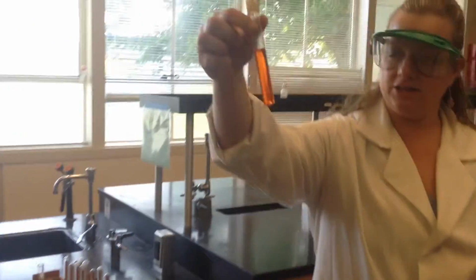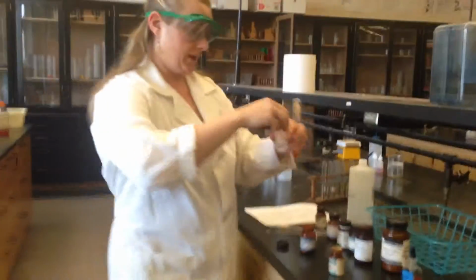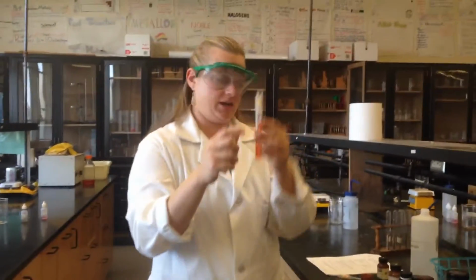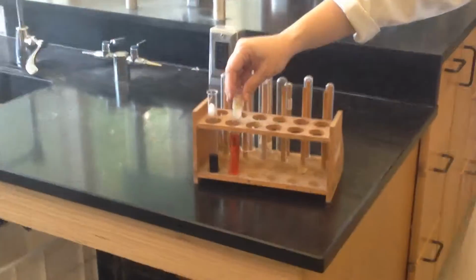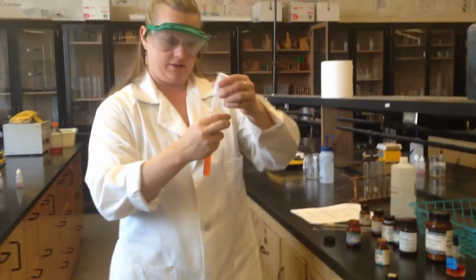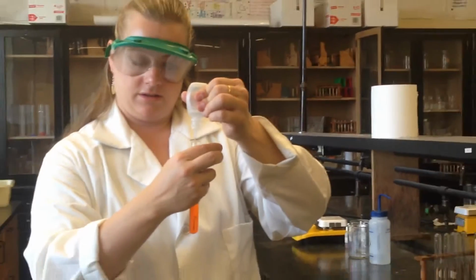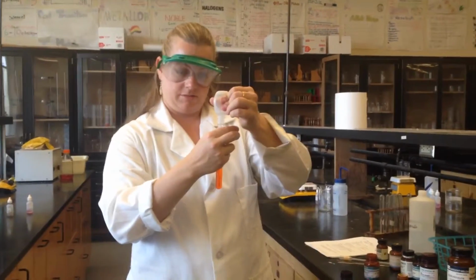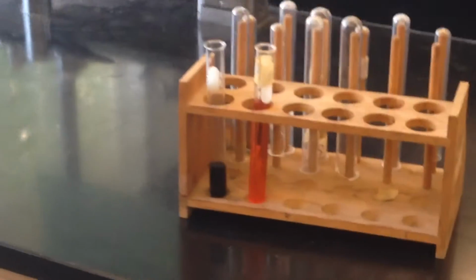So it's starting to turn a little yellow, but not too much. So this one we would say is not going to work well for the pH range. We would have to add way more acid to get a color change. If we added more, it would get yellower. I could probably try and add a little more, but I think I put too much base in here. It's coming out really slowly. Anyway, it's getting lighter, so we can put a little more in there.